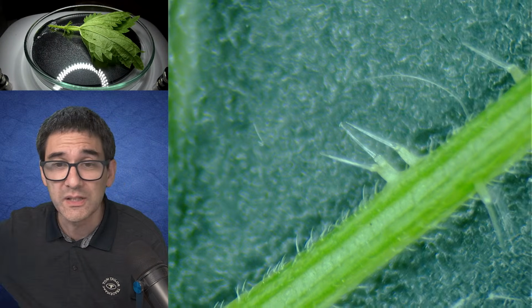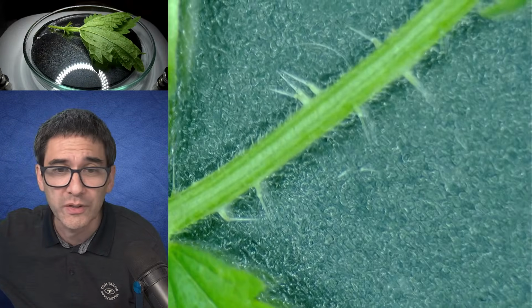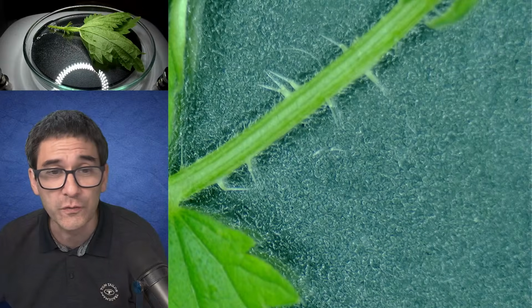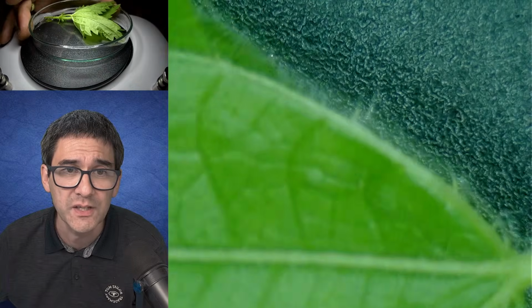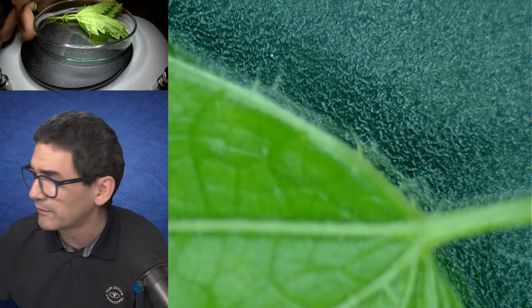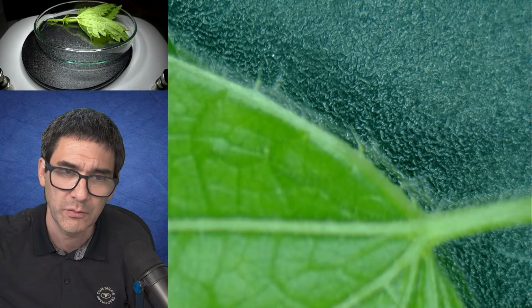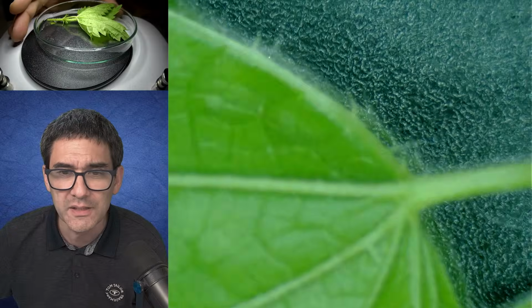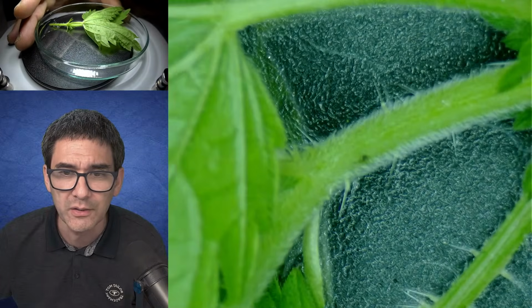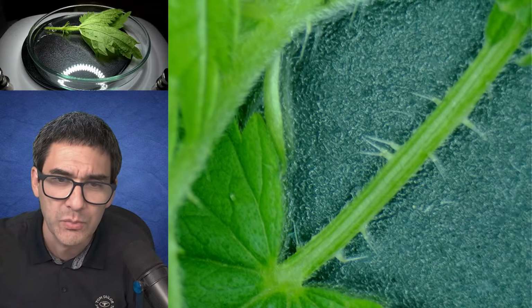Okay, so let's see if we can go in yet further. No, I'm going to show you the low magnification first. So this is how it looks. Then you can see that over here on the stem and also here on the side of the leaves, sometimes you have to go into focus, you're able to see that they're quite spiky here. So this is basically the reason, and I want to show you something here. Let's take those big ones over here. What actually happens when you touch them?